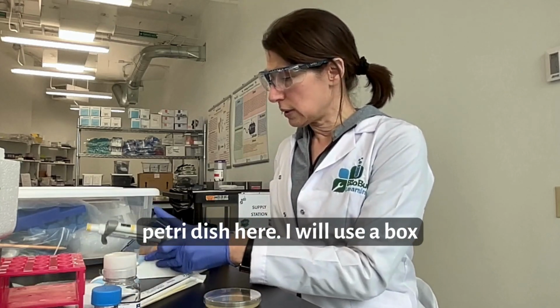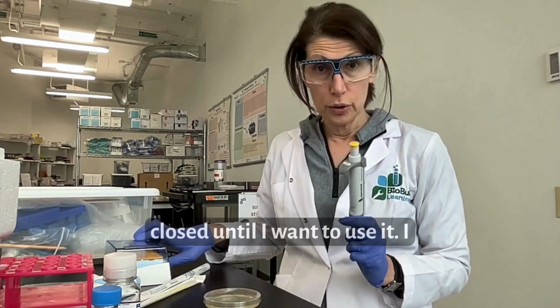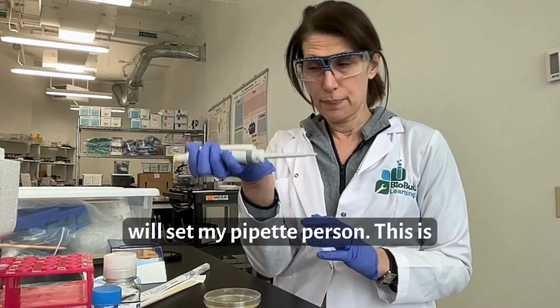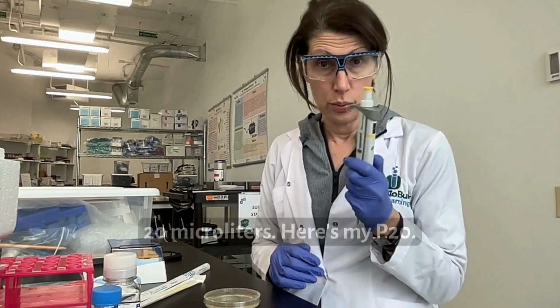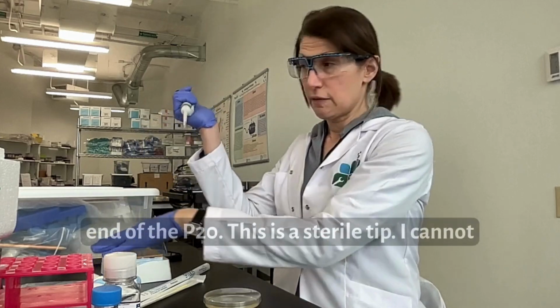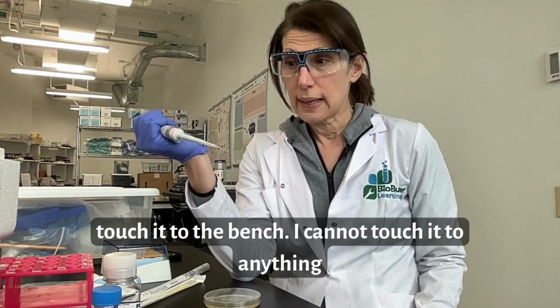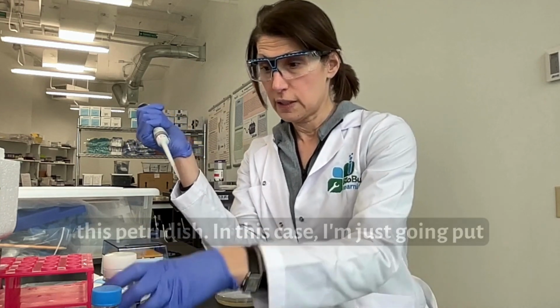I will use a box of sterile pipette tips that I keep closed until I want to use it. I will set my pipette down. This is a P20 actually, and so let's say I'm going to spread 20 microliters. Here's my P20. I'm going to put a sterile tip onto the end of the P20. This is a sterile tip. I cannot touch it to the bench. I cannot touch it to anything except what I want to put onto the sterile surface of this Petri dish.